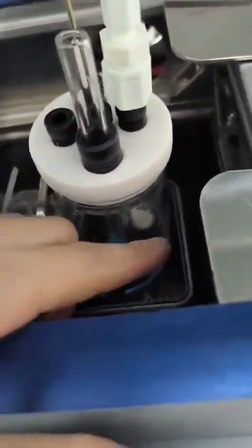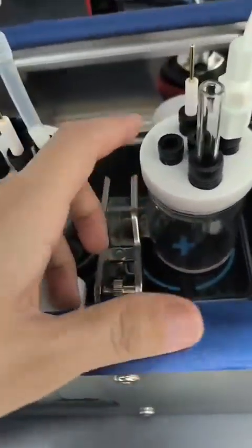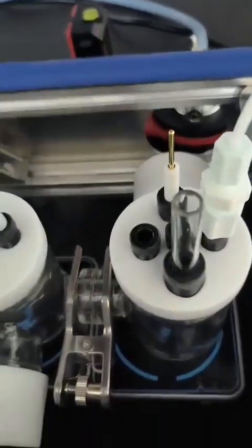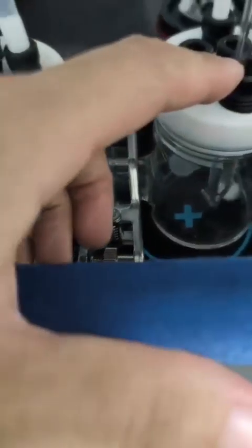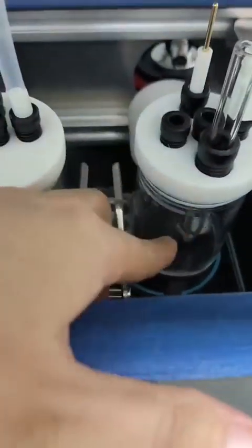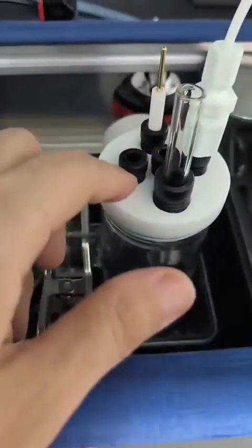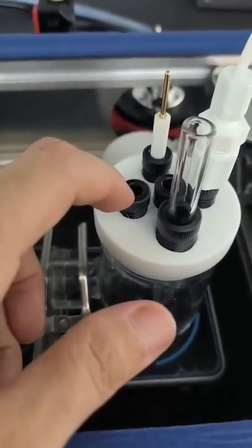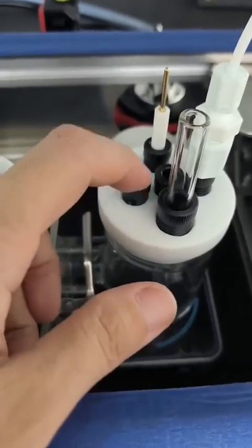We can see from the reactor there is a gas distributor to plug the gas in, and your working electrode fits to the optical resource, and your reference electrode is installed beside the working electrode, and the Luggin capillary tip fits to your working electrode. Another port you can install with a Teflon tube for liquid collection, as in our training. And the port you don't need, you can block it with the blocker.